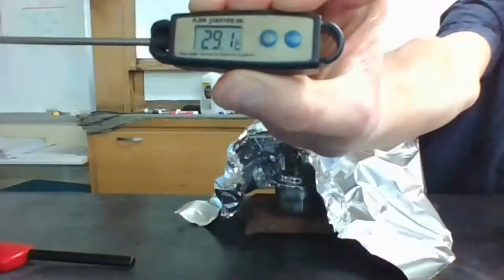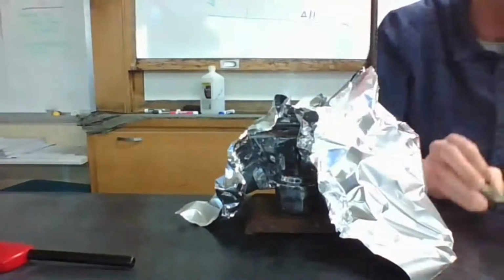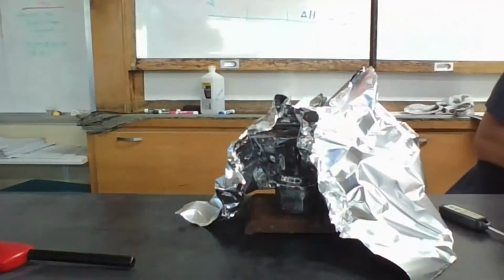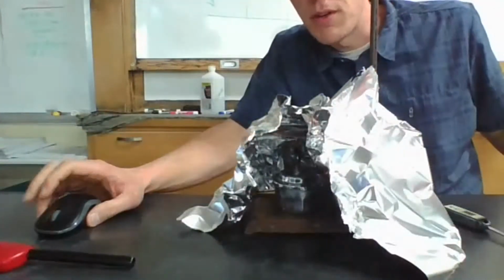I don't know if you can see it, but I got 31.5. It went down very, very quickly, but trust me, it said 31.5. So I'm going to go ahead and record that over here. And I'll switch screens for a second.